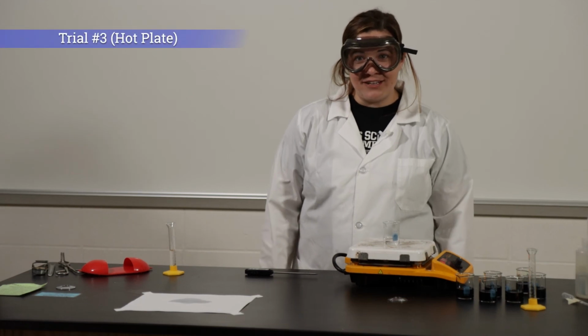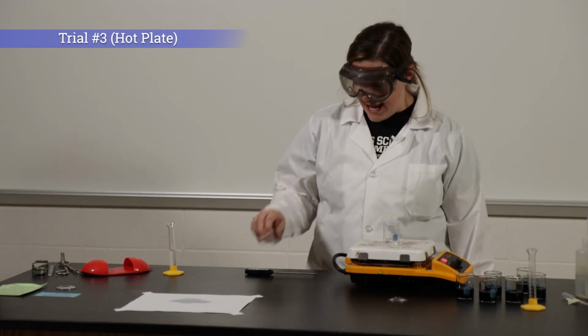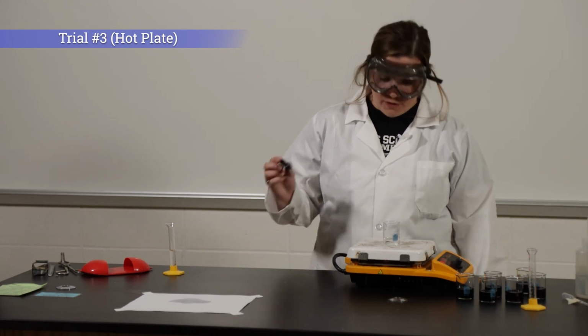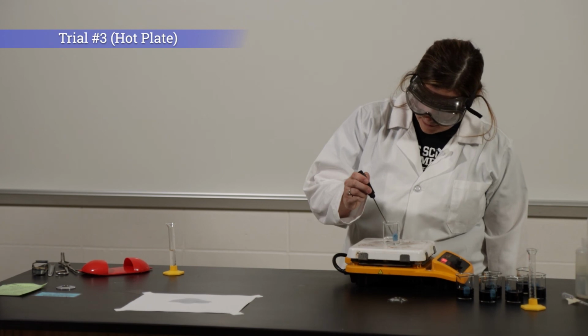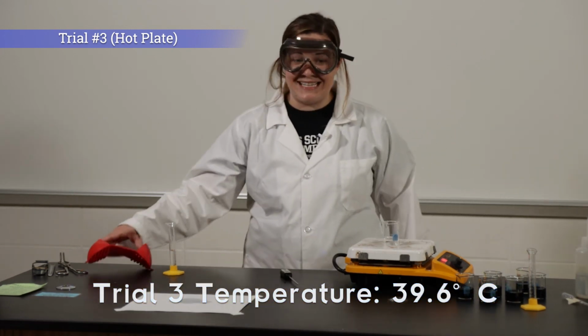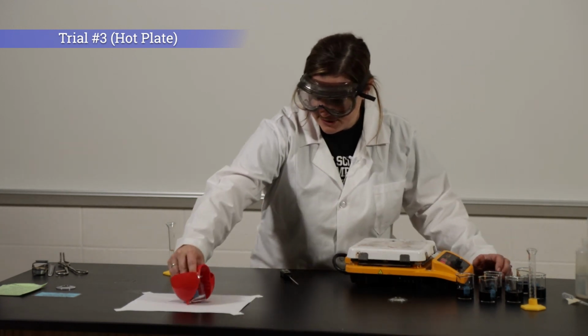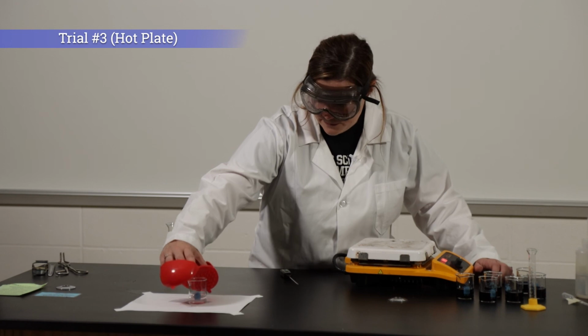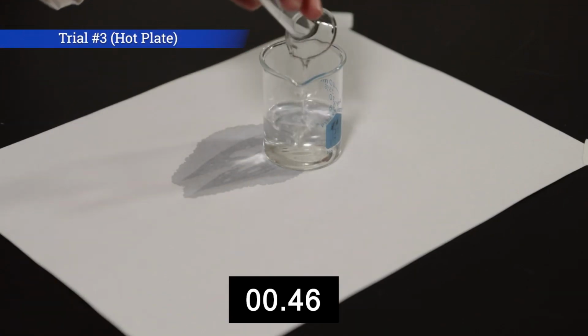For the last trial for temperature, I am heating my solution A on a hot plate. So I'll start by taking the temperature, and the temperature is 39.6 degrees Celsius. We'll add solution B, record the time that it takes to turn dark blue.